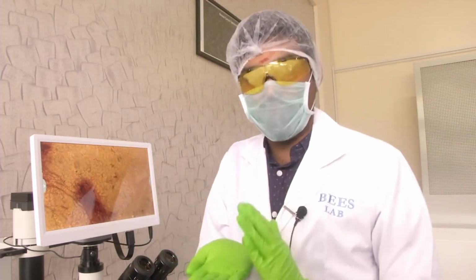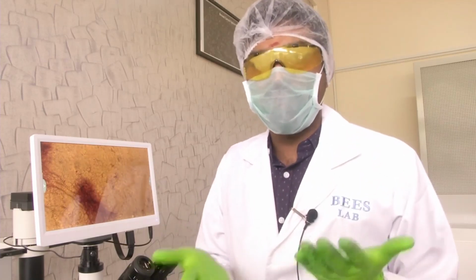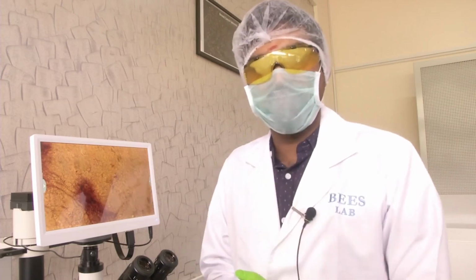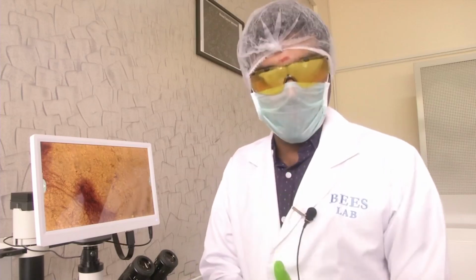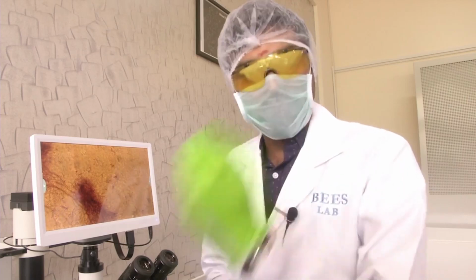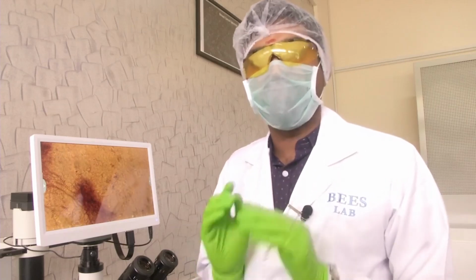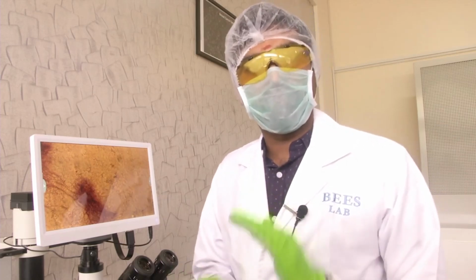This has to be very clear to you, because at any point people will ask you why different types of microscopes are there, what is their utility, why are you using this, we can use that only. No, you should be in a sound position to tell them that this is my application, this is why I need to go for this microscopy, and this is the size of the object that I am looking for, so I need to go for an objective of this magnification. Before you go and do your experiments or your imaging, you should be very clear what you are looking at, so that you do not end up making mistakes which are very silly and avoidable. So, you should do your background work properly.